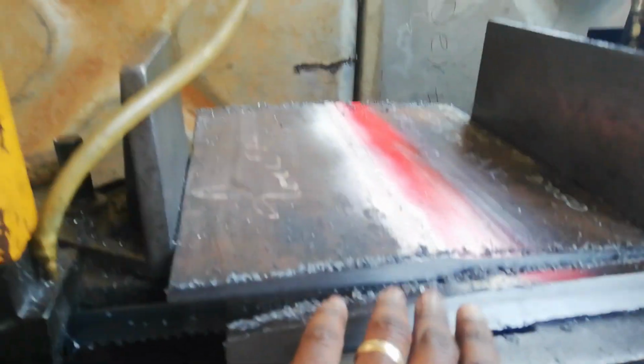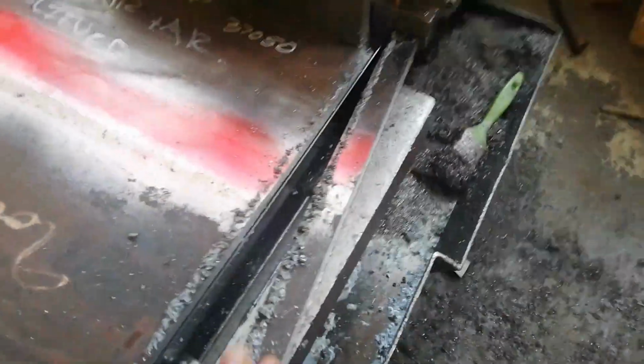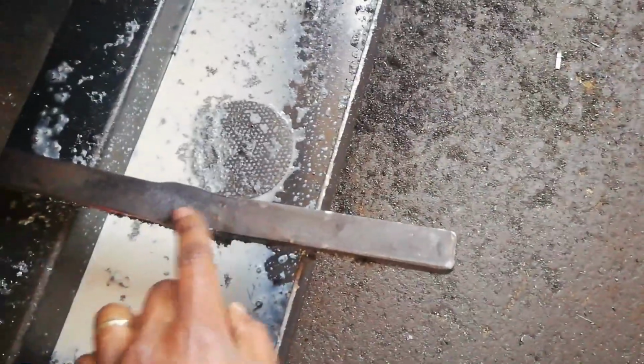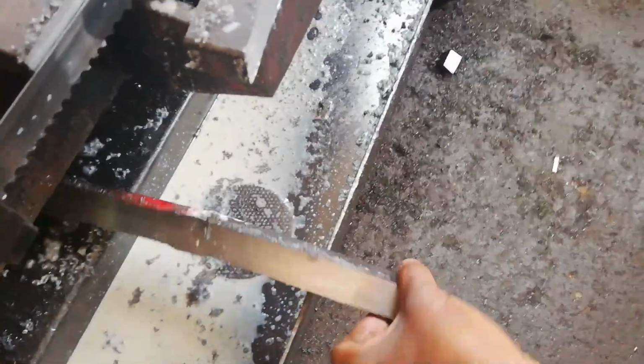Now here I can show you the case of a plate. I said that plate should have been longer. This is an example of a longer plate. So here I have a tensile. And here I have the part that was discarded. You can see there. This part here was discarded, that side there, and then they cut. This is how it looks.